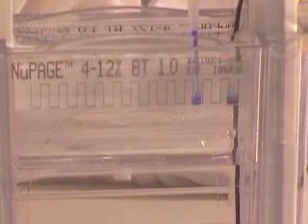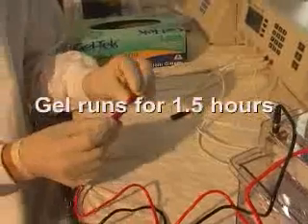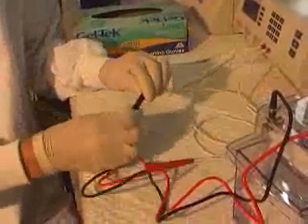The technique to determine the size of gold nanoparticles by electrophoresis was developed by Reddy Serenivasaloo at RMIT University. The size of the gold nanoparticles can be determined by the distance they travel through the gel compared to a series of molecular markers.